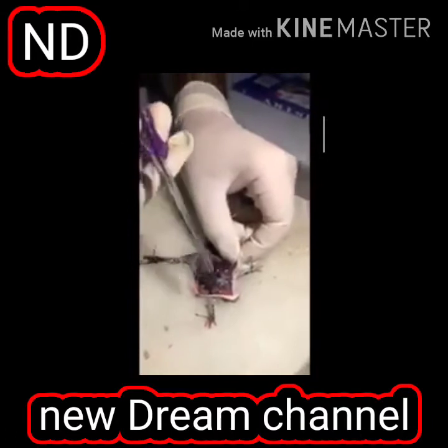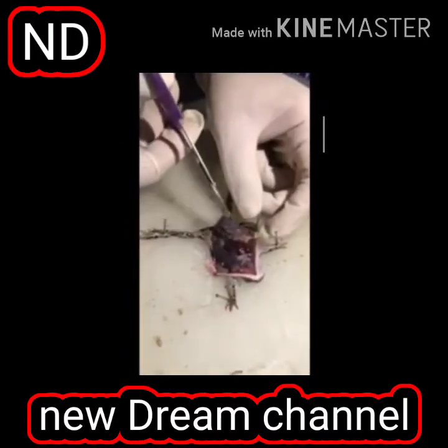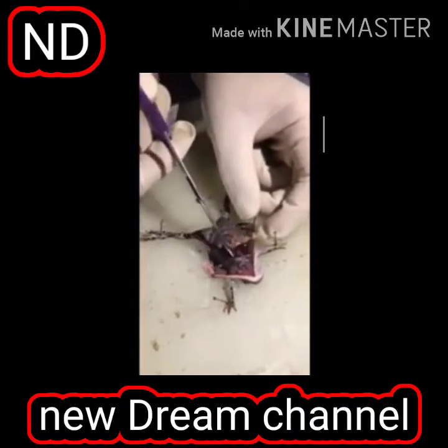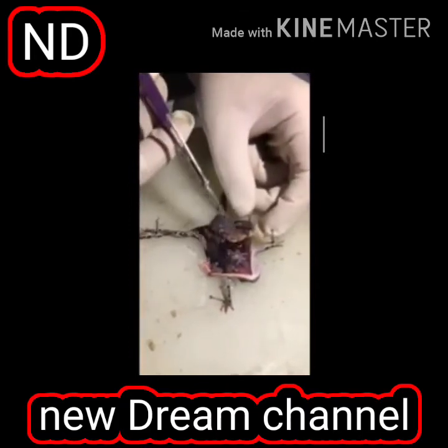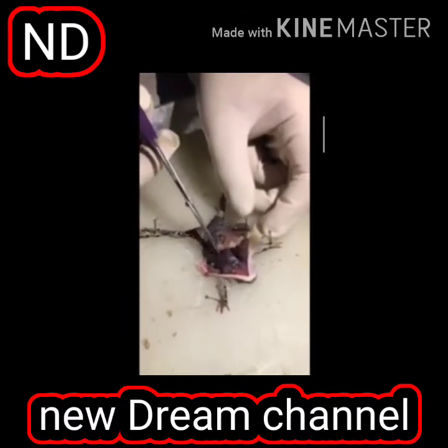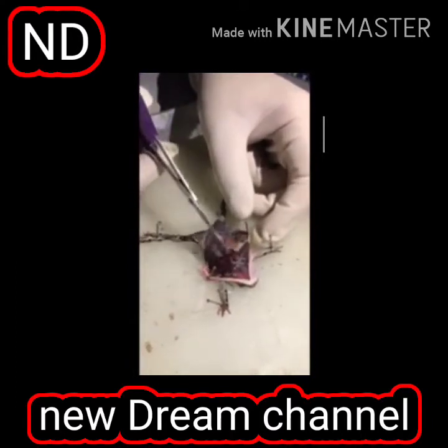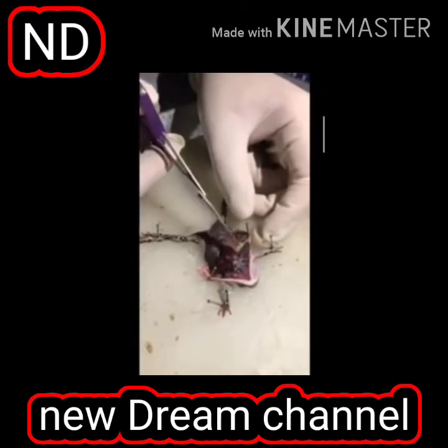That is the heart. And what you see here, what is this? This is a very elongated lungs. This is the lungs. This you can see properly developed lungs. And you can see the lungs here properly. This is heart. You can see it's still beating.